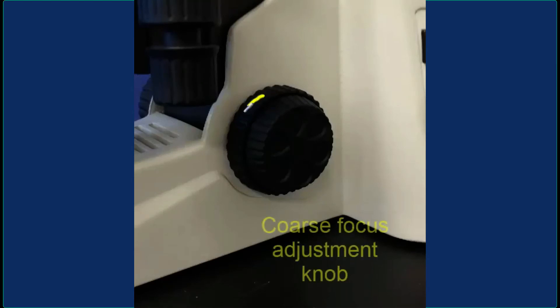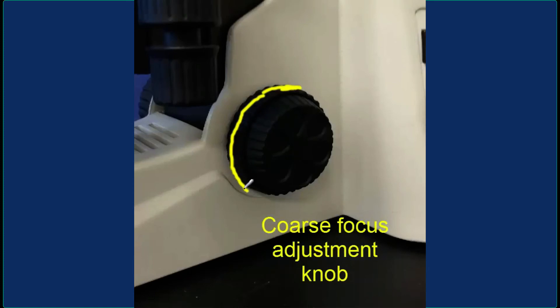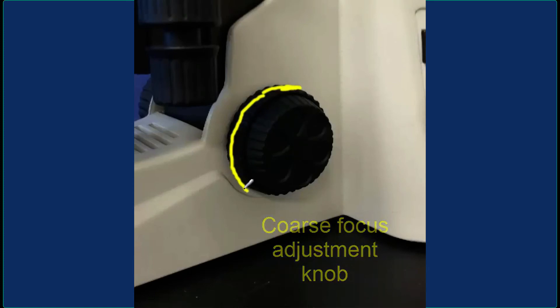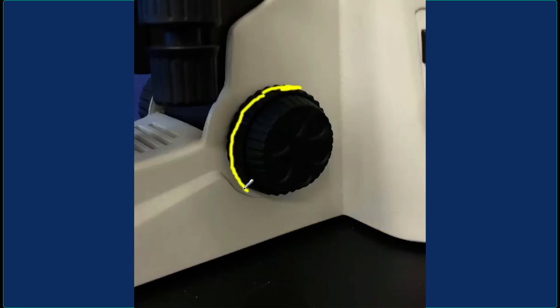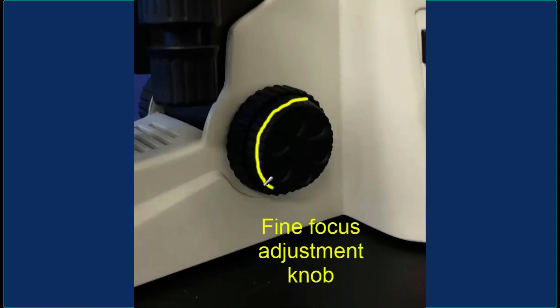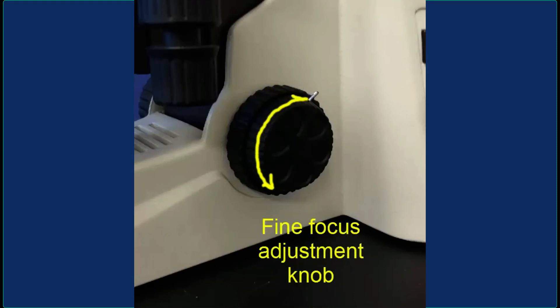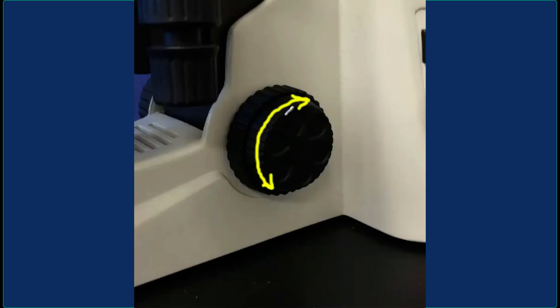Here is a closer view of the focus adjustment knobs. The larger one is the coarse focus adjustment knob — that's the knob you use when you want to move the specimen more rapidly to get it into focus more quickly. The one that's further out and smaller is your fine focus adjustment knob, which you use to move the stage more slowly to achieve a more precise focus.